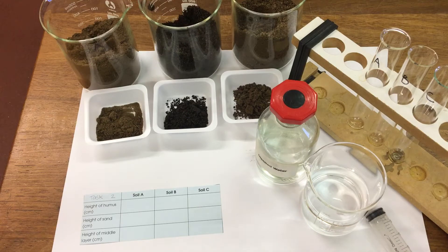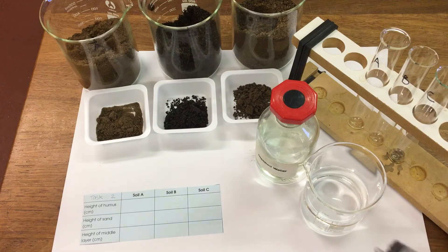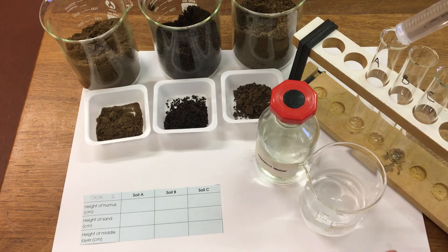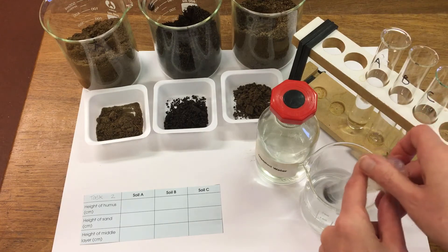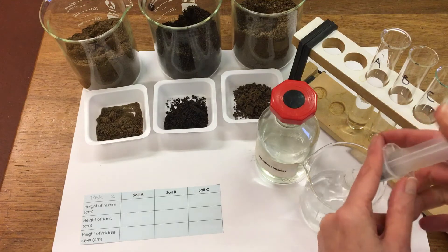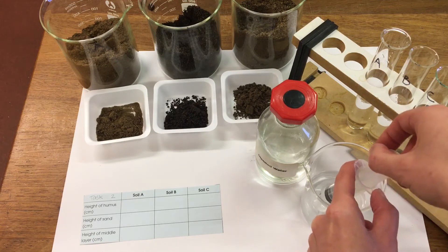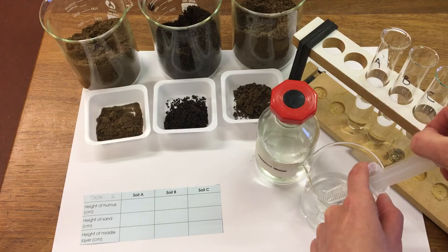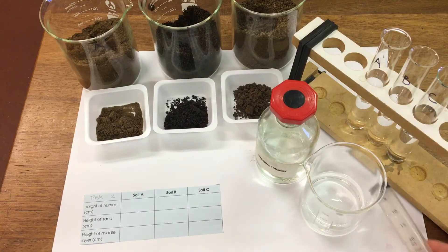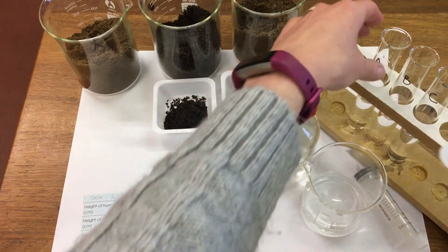First of all I'm going to add 20 mils of water to three boiling tubes, and then I'm going to add our 10 gram soil samples from task 1, which we weighed out, so these are going to go into the boiling tubes.